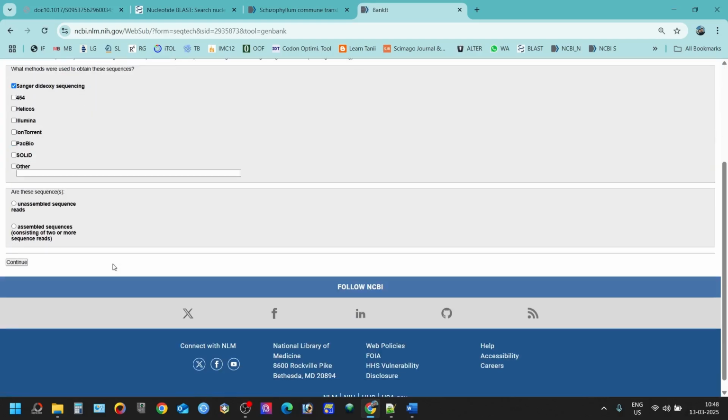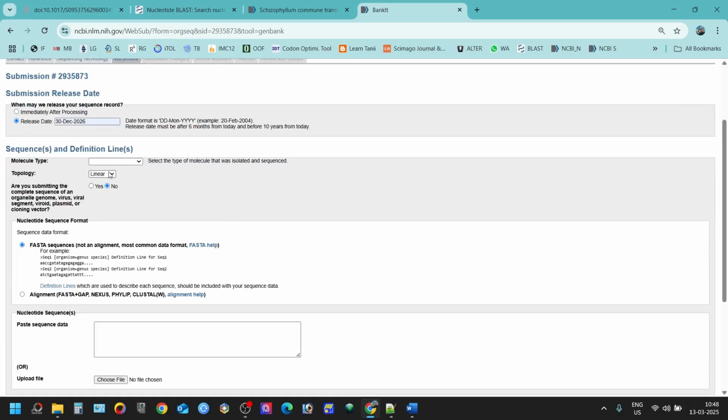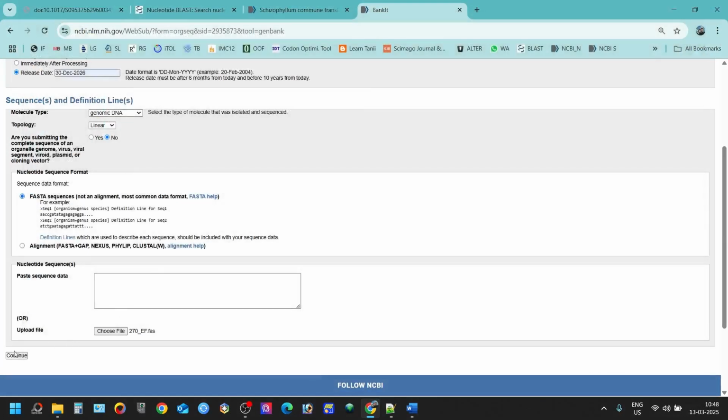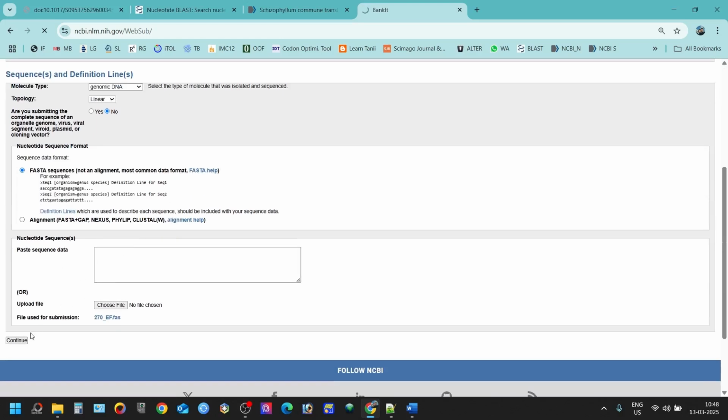Press Sanger sequencing if you have done, and these sequences are assembled, so you have to click here. If you have unassembled sequence, you have to click here. And release date, you can choose any date. I'm just choosing this one. Molecular type, our DNA is genomic DNA, and it is a linear DNA because it is eukaryotic DNA. So you can choose your file here. Now press continue. Press continue.